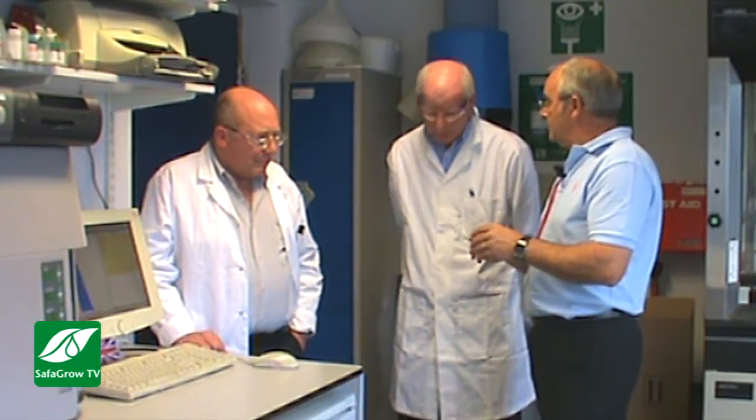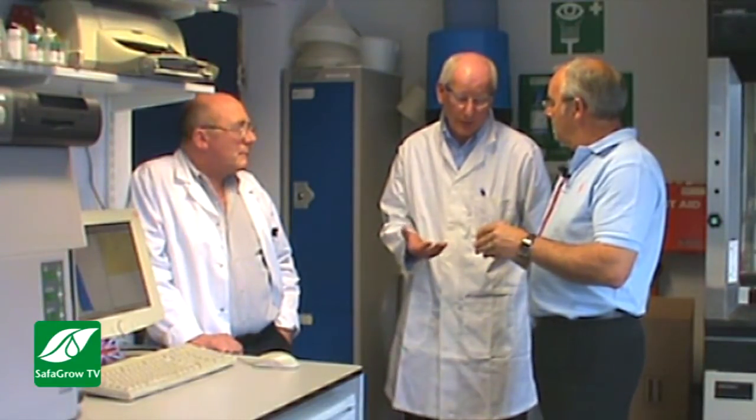So that's fairly small, 2 micron. How long do they have to stay in that mill to get them down to that size? It depends on individual products, because we have different specifications, and the hardness of the raw materials. But the throughput is somewhere around 800 kilos an hour.